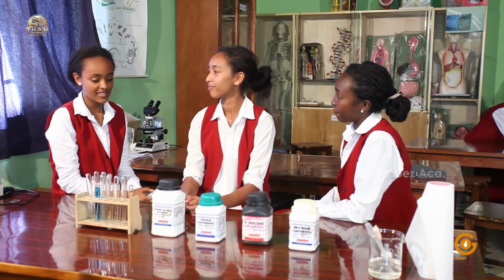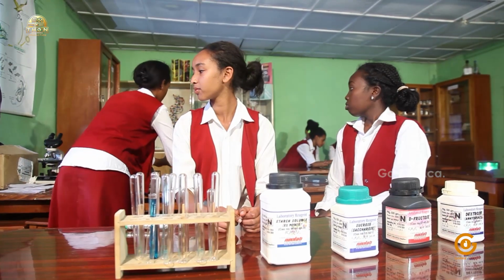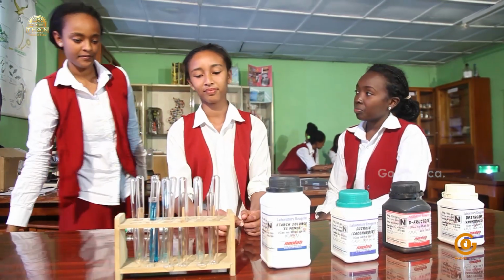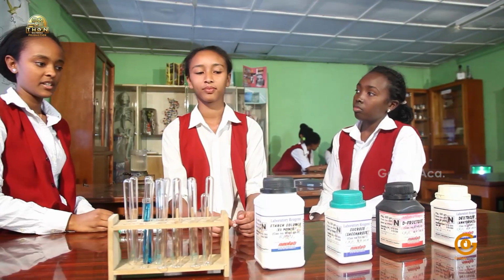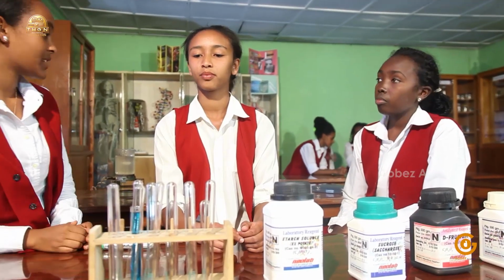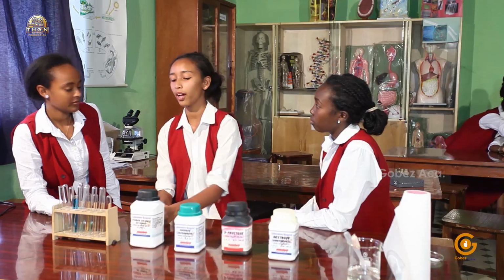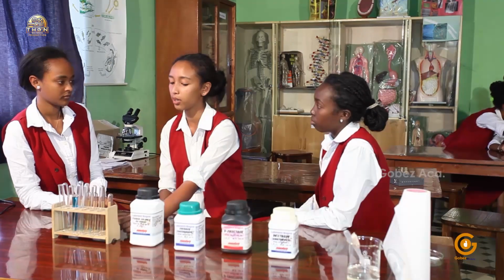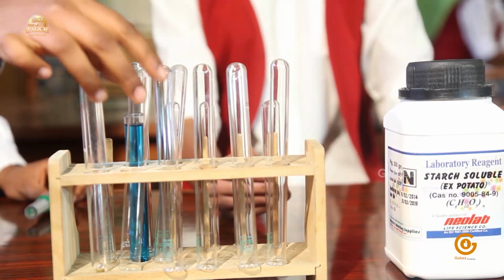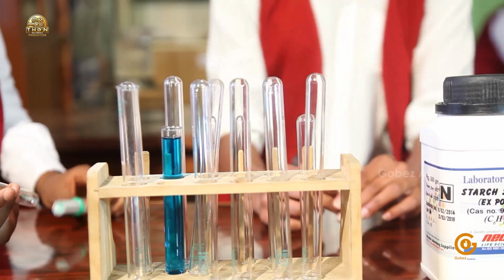So the first step in this experiment is to take the beaker filled with water and put it on the stove and bring it to the boil. In the meantime, we take 6 separate test tubes and put into them tap water to about a depth of 2 centimeters. Okay, but then we have to leave one test tube to be of control and label it as control. To each of the other test tubes, we respectively add the different carbohydrates we have here and dissolve them in the water. Then after, we label them respectively.